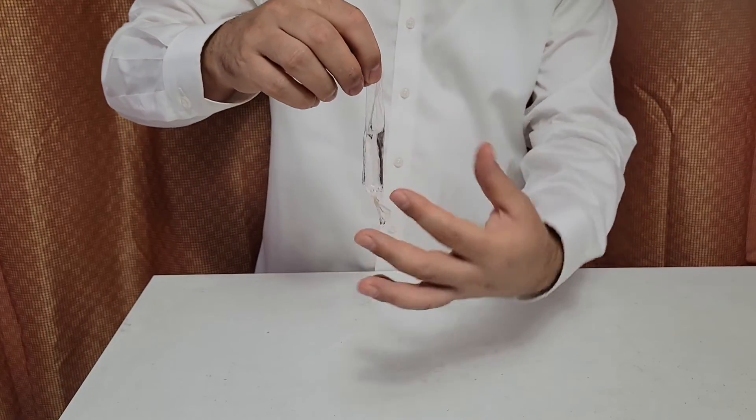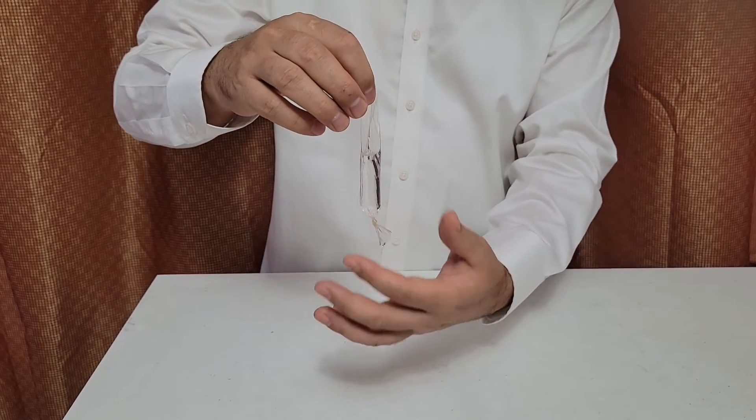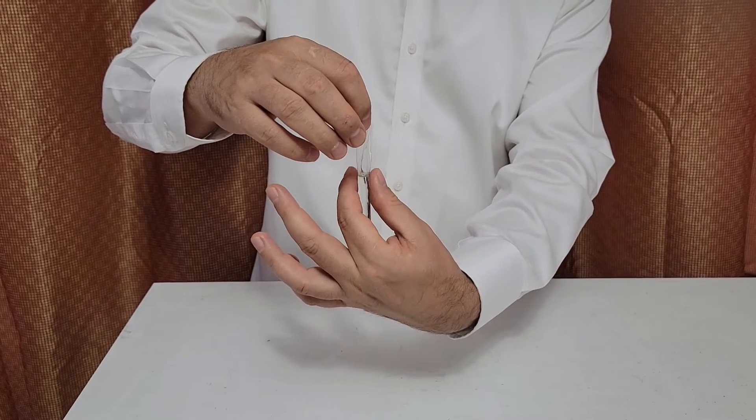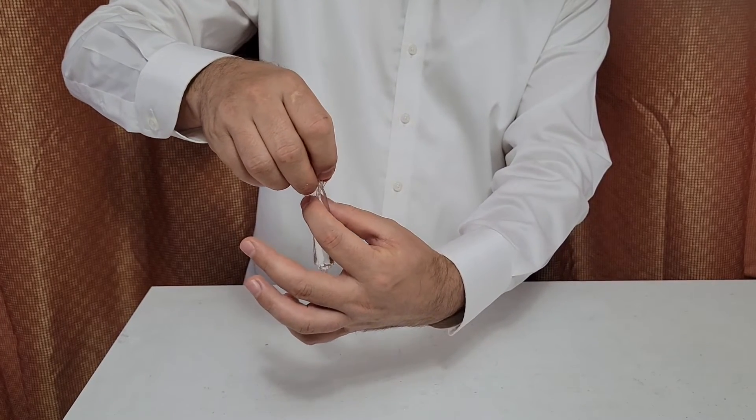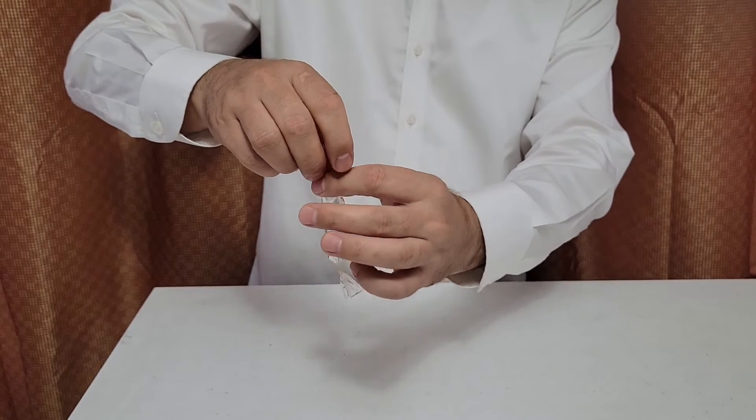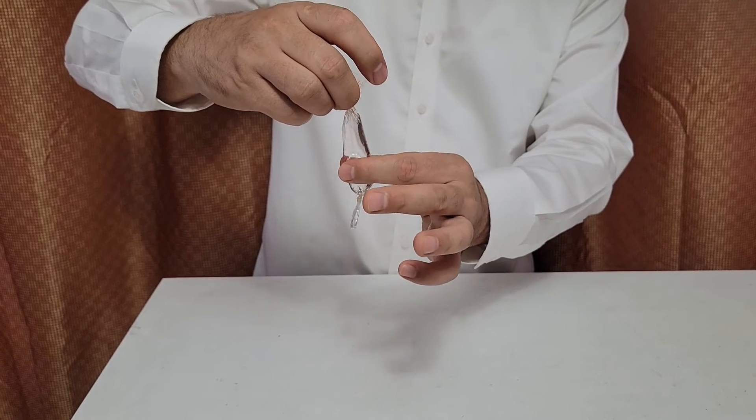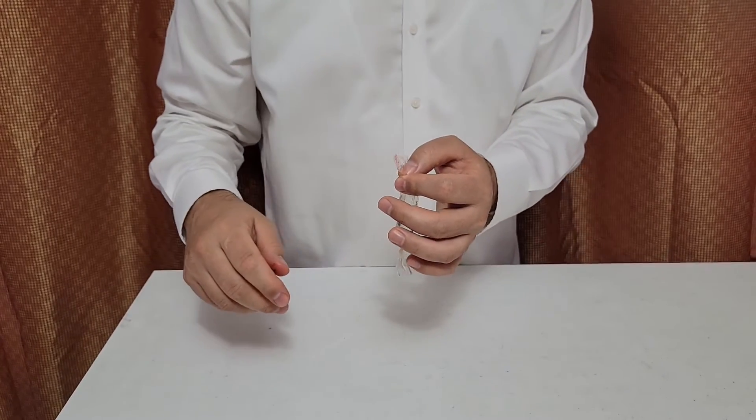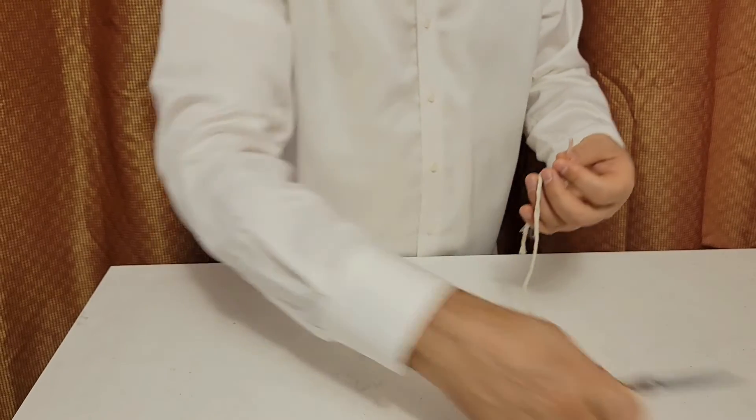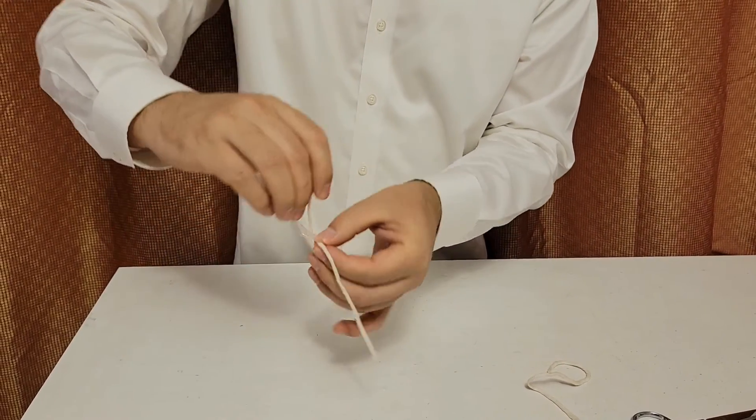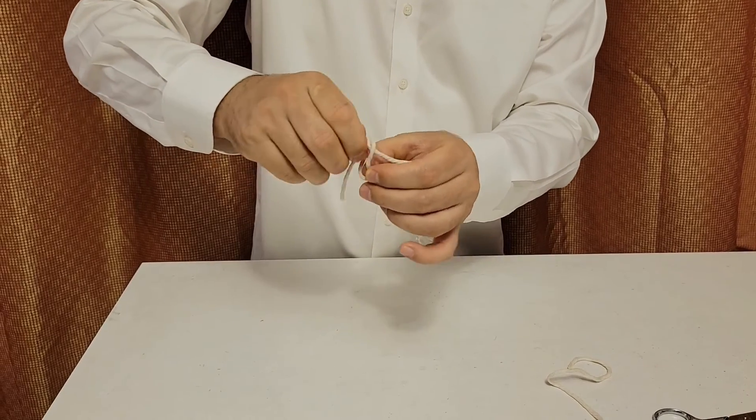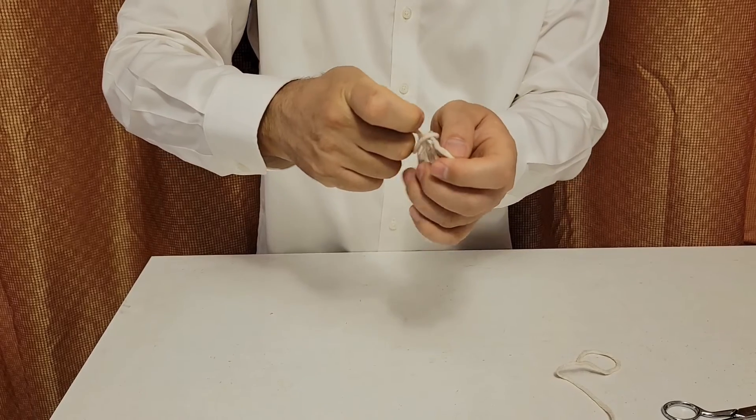Now the trick is to pull out the air of the bag. And you don't want it to be too tight. So with your two fingers, you press it like this and start turning it. Make sure there is no air trapped and the bag should be loose. You see how loose the bag is? That's how it should be: loose and without air. So you turn it like this. Make sure there is no air and the bag is not too tight.